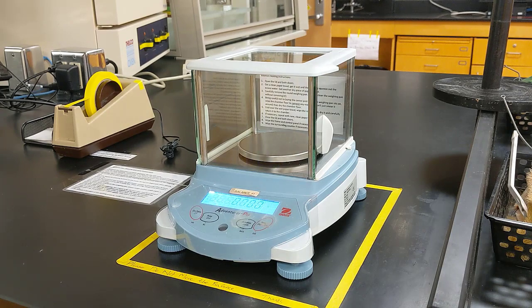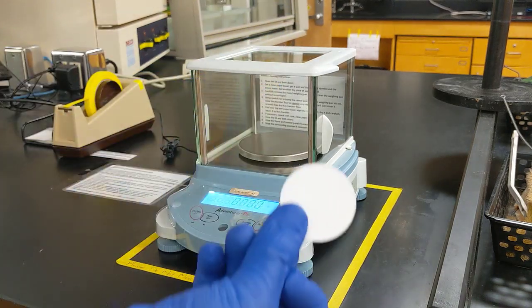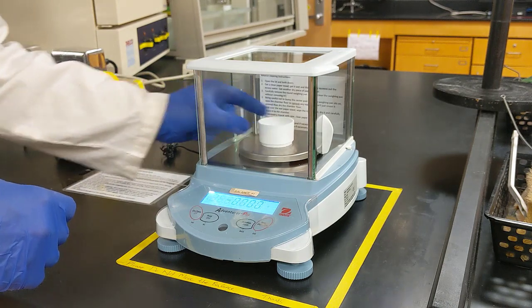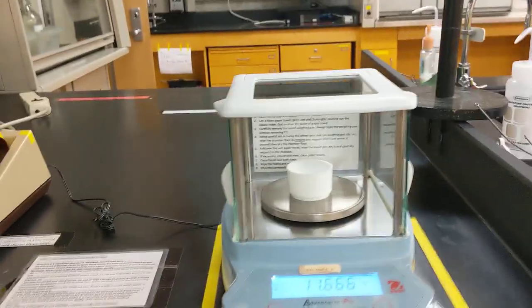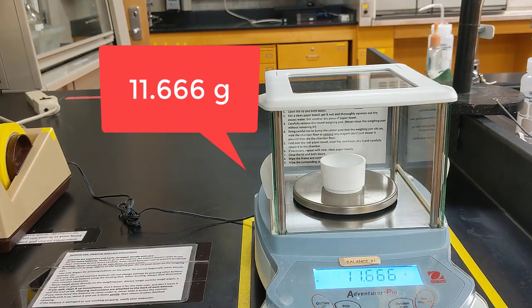Alright, so one other thing I can do while waiting is I can get the top off of my Buchner funnel, grab a piece of dry filter paper, and get the mass of both of these. So I'm going to go ahead and pre-weigh both of these. That way when I'm done vacuum filtering, I can just put it back on the scale and record the new mass. So let's go ahead and get the new mass, or sorry, the original mass, which is 11.666.